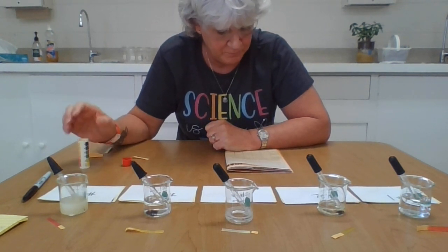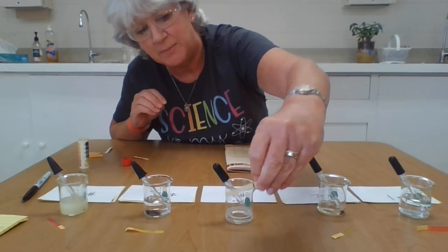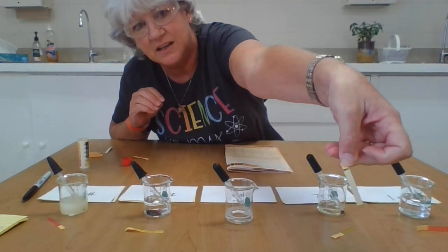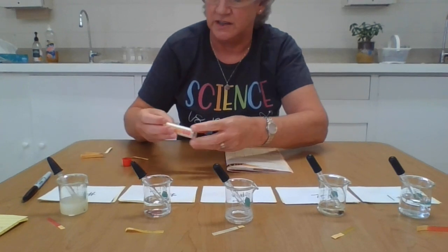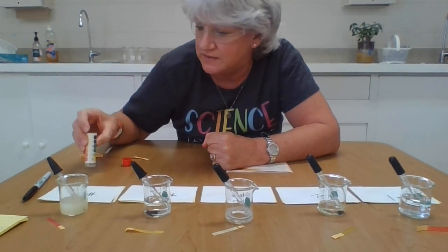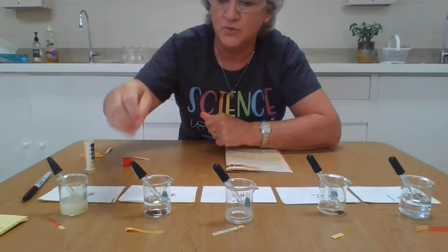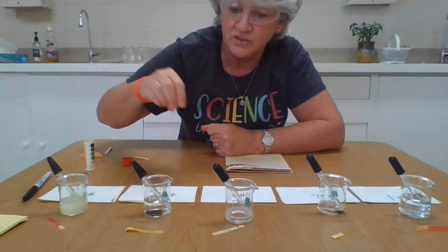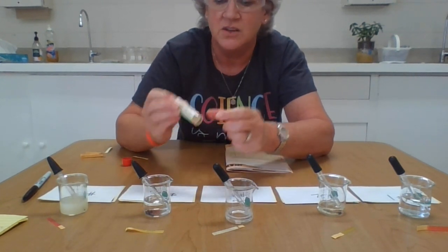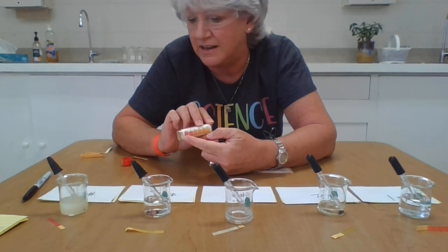Okay. Number 3, substance number 3 turned immediately. These are older papers, I apologize, but you can still see some of it left there underneath my fingernail. It turned immediately the darkest blue, number 12. These don't go up to 14, these go up to 12. So it was definitely alkaline or basic. All right, number 4 turned immediately the color number 6. So it was kind of neutral, but a little bit heading towards the acid side.